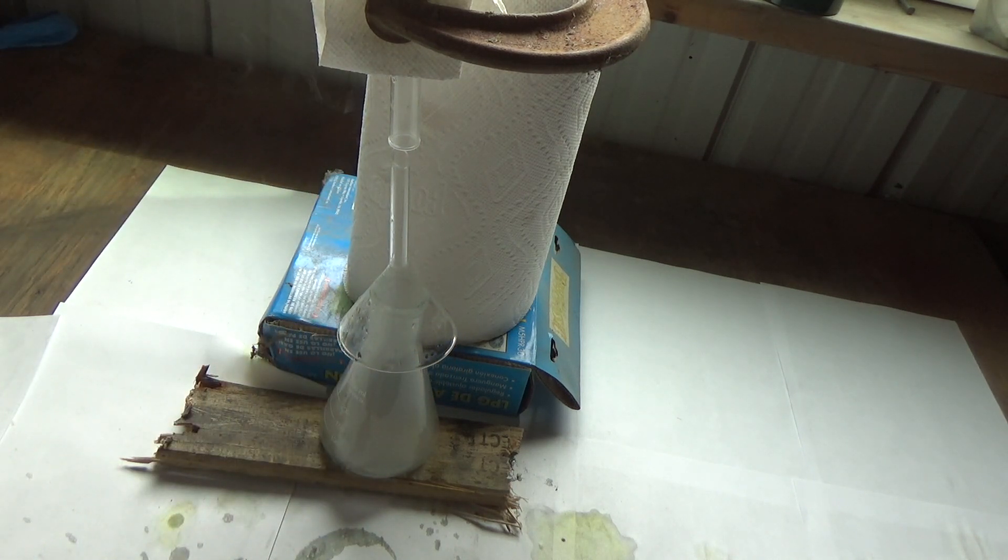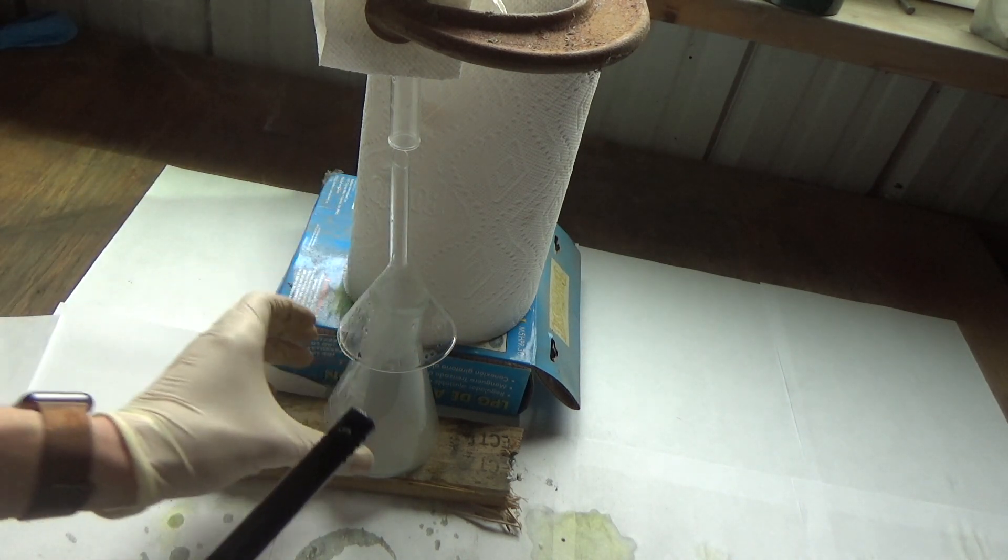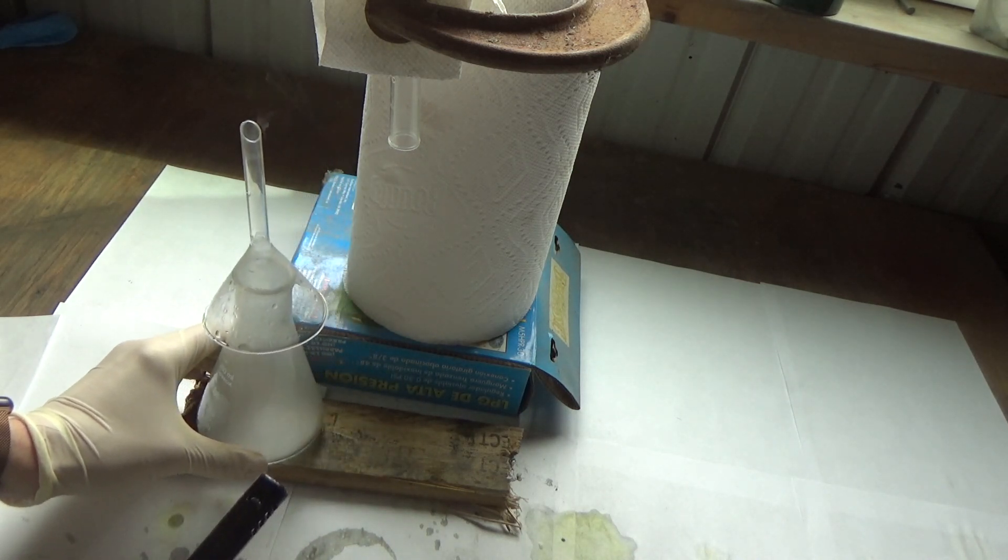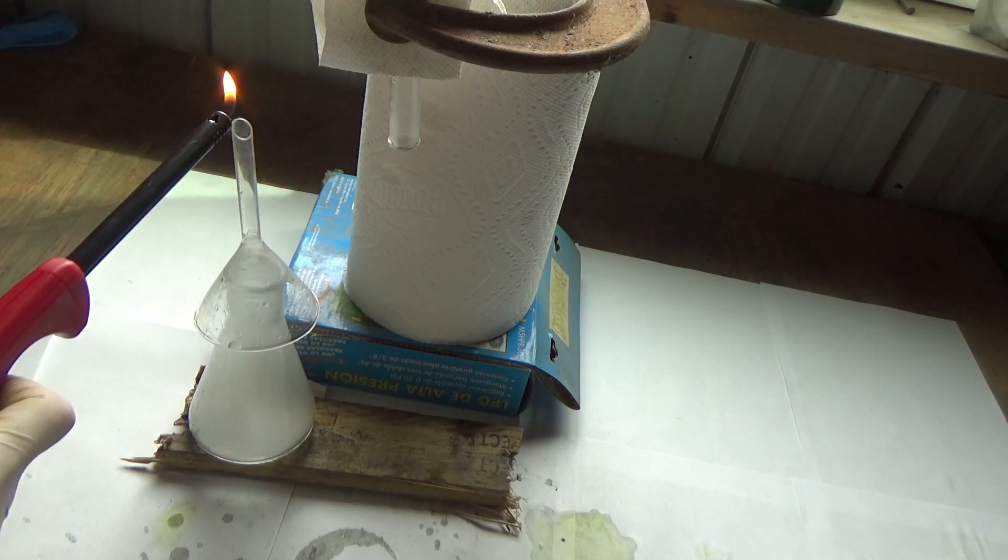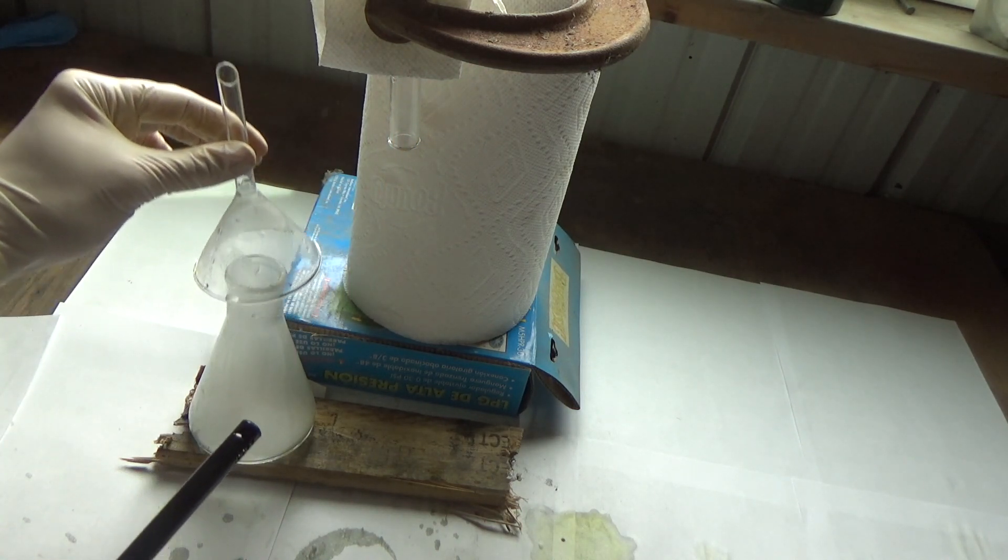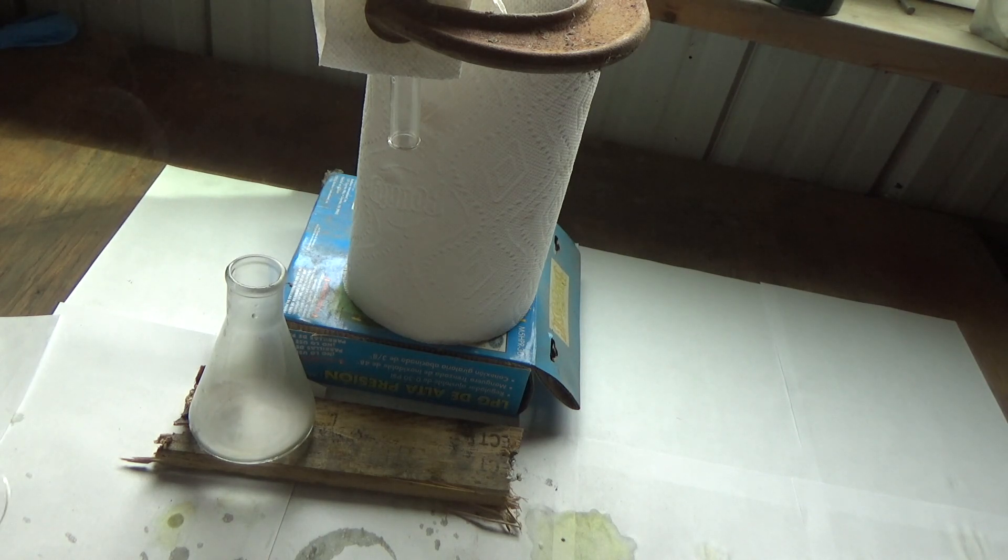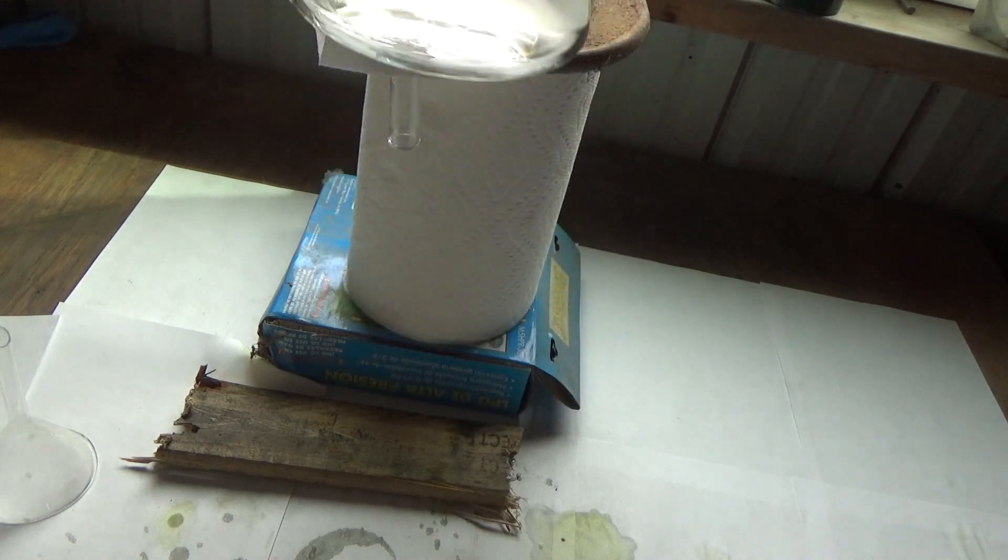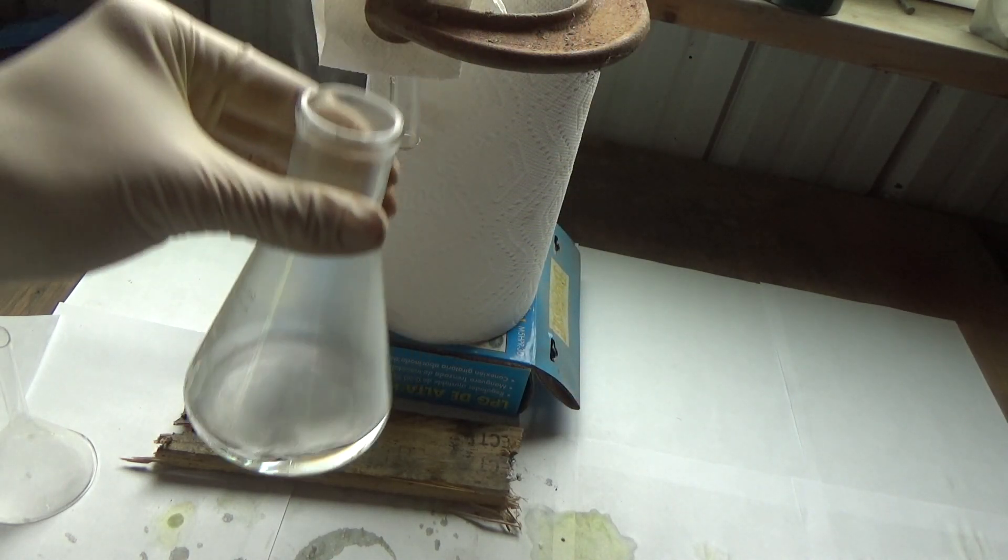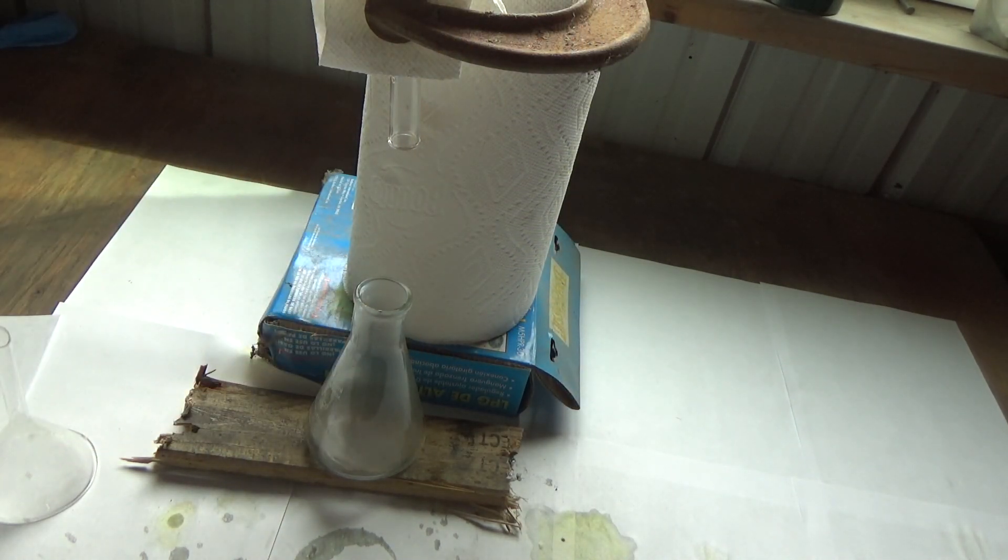About to find out. I have a little lighter right here. That worked. So the test tube thing didn't work. But that was very loud. So I lit the hydrogen that was in the flask. And it sort of made like that barking dog sound that you hear in some chemical experiment.